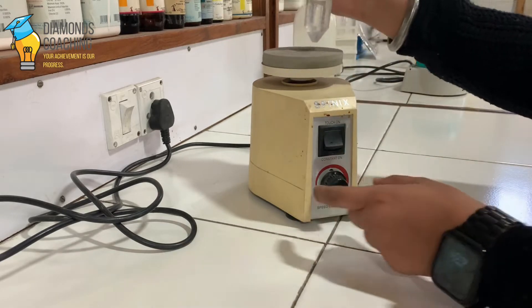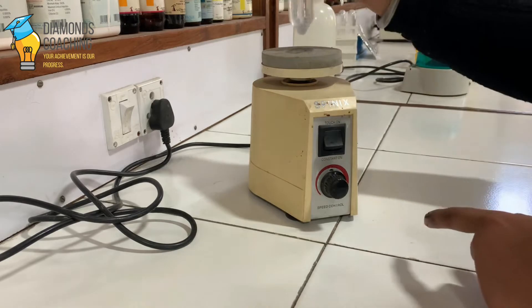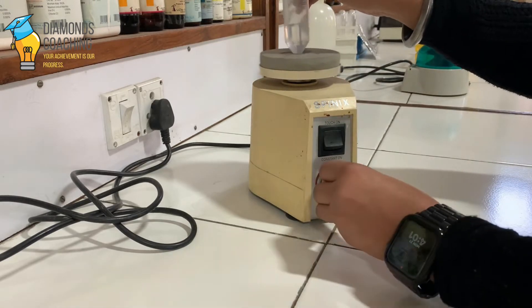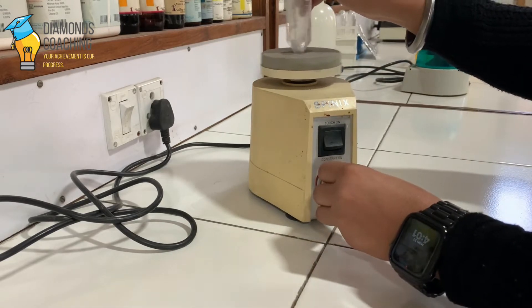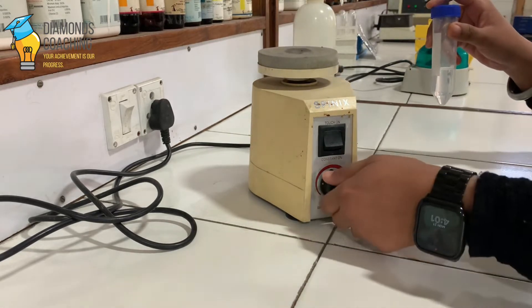So let's do it. We are increasing the speed. This is the speed control where we can increase or decrease the speed of the rotation or the shaking.